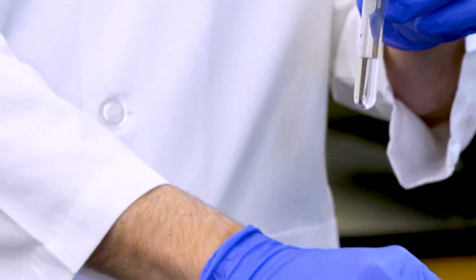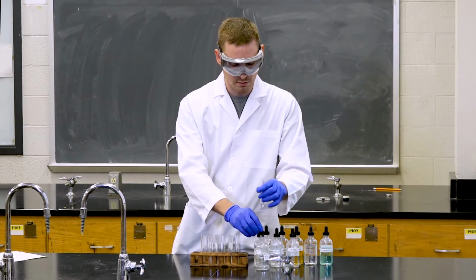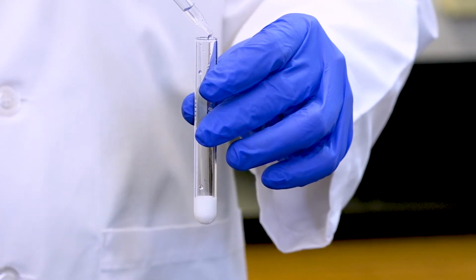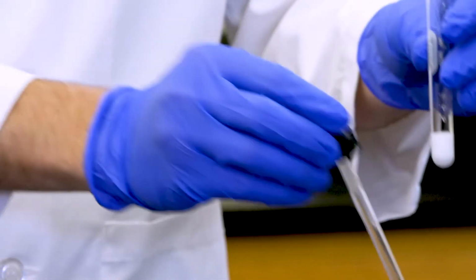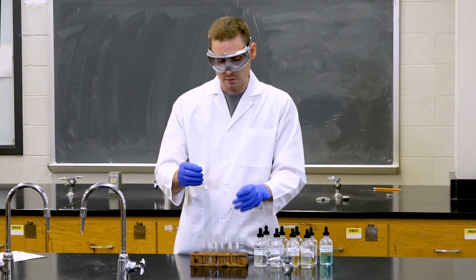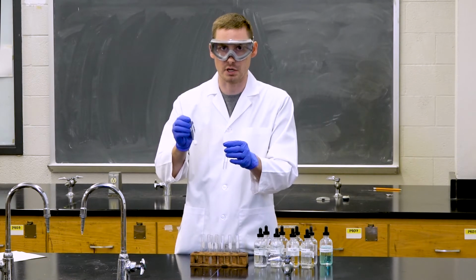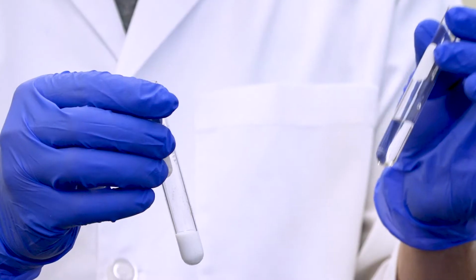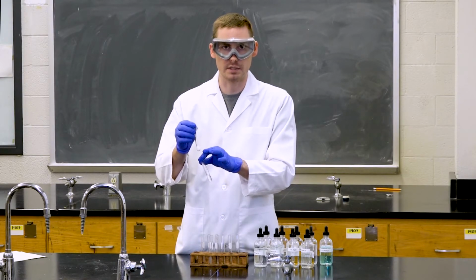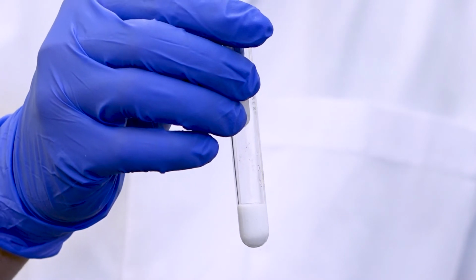And as you can see, no precipitate has formed. And then we can add it to our sodium chloride solution. When we compare the two, once again we have a very strong white precipitate that has formed in this test tube, while in the distilled water test tube, no precipitate has formed. The solid precipitate that has formed in this test tube is silver chloride. And once again, if we left it undisturbed, it would eventually fall out of solution and collect at the bottom.